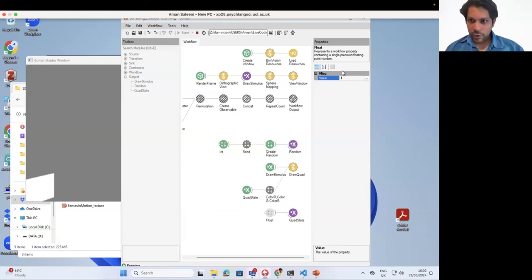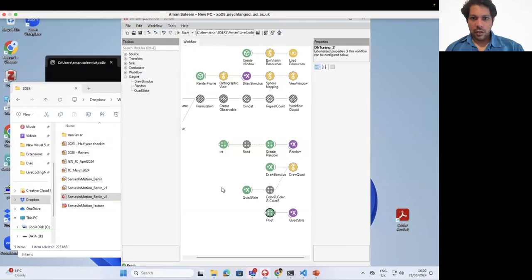All right, so you can see now that as you change the values, if I make it 0.5, it will merge into the background. Okay, so that's basically defined this quad. And now what we want to do in this particular case is, let's say we want to have it go white or high when the stimulus turns on, in this case the grating, and we want to go to black when the stimulus goes off.